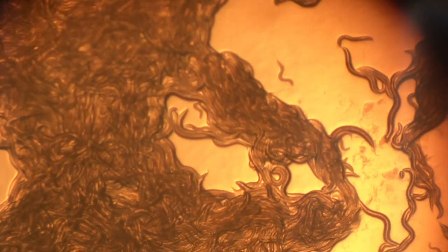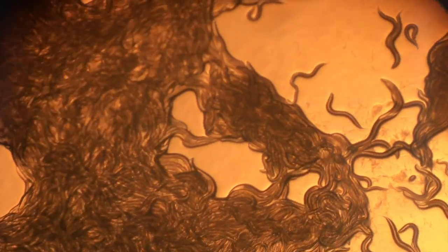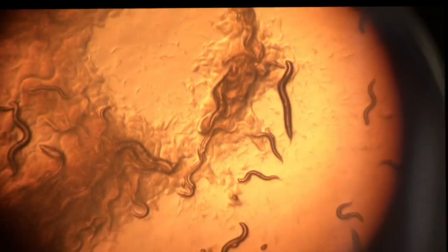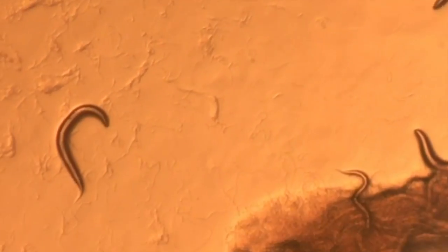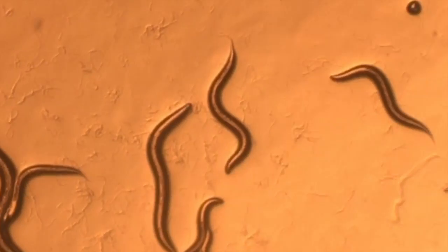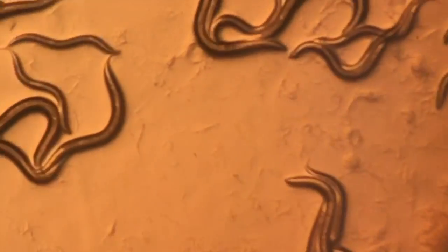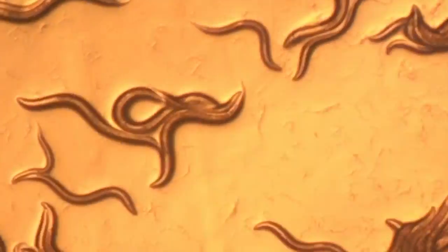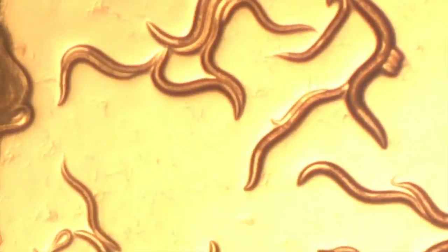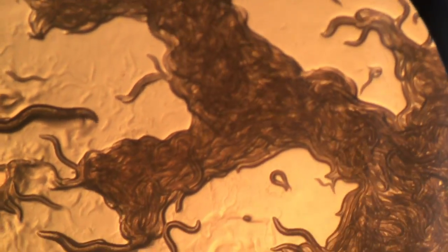we observed wild-type worms on NGM agar with OP50 bacteria for them to eat. The wild-type C. elegans were moving forwards in S-like waves fairly quickly, and they were easy to spot because they were opaque. The eggs were very small, and there was a fair abundance of them throughout the plate. As the stages progress, the adolescent stages of L1, L2, L3, and L4 have increasingly long and thick bodies, with the adults being the biggest.